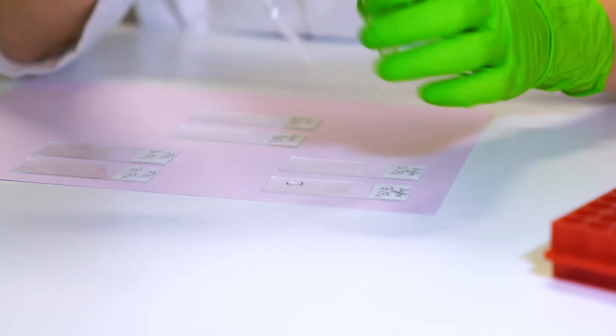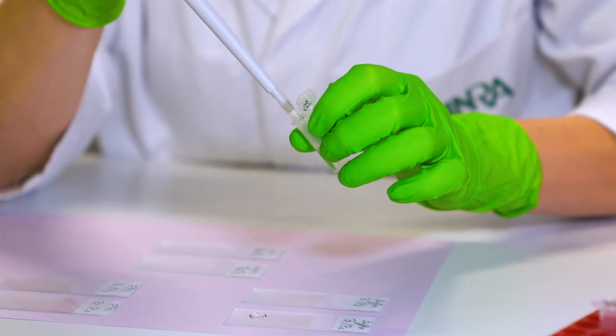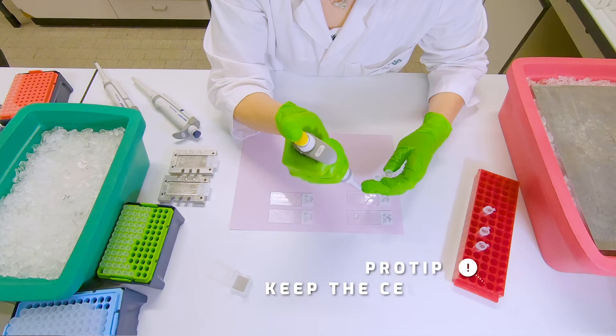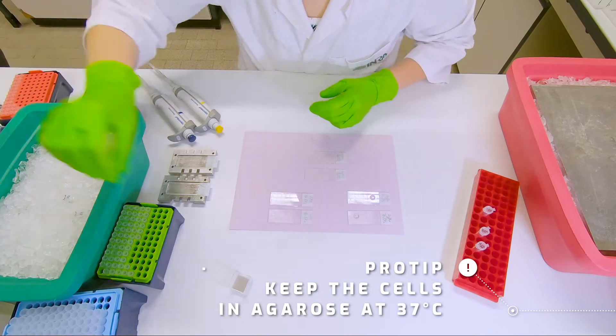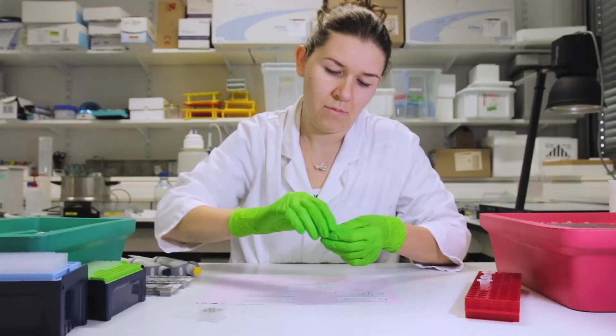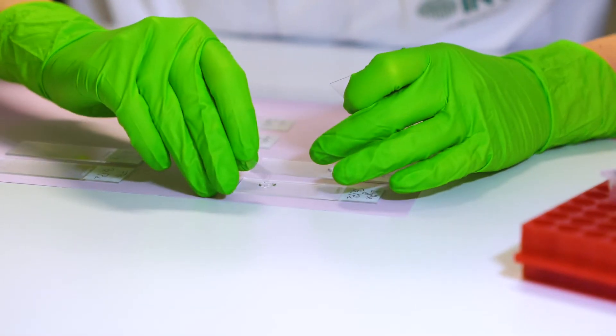Then place a drop of 70μL of the mix in each of the glass slides and place the cover slip on top of each drop.